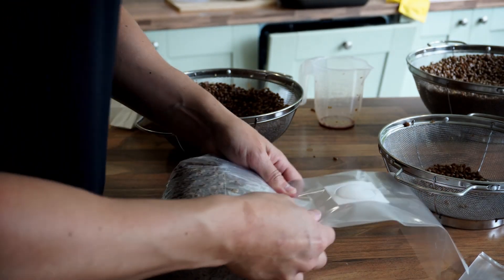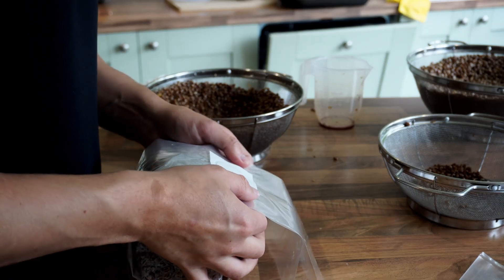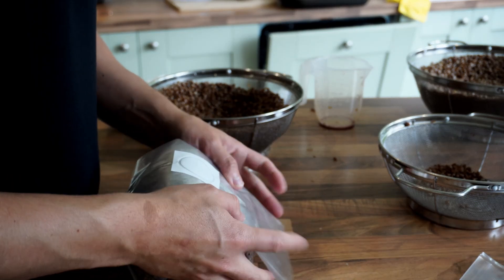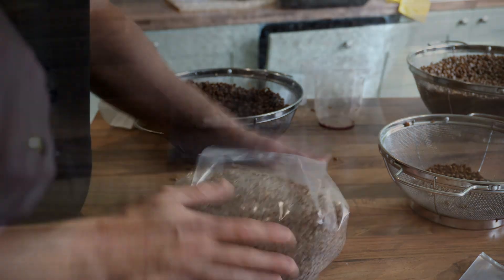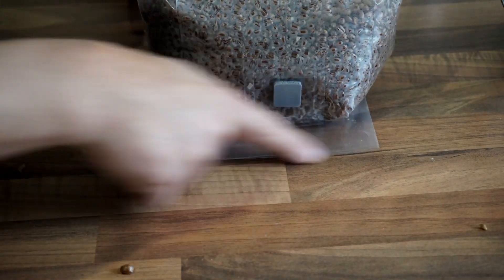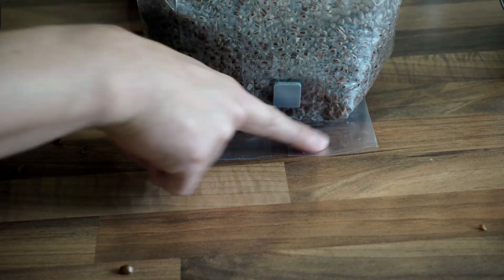If you have a look you'll see I'm not sealing the grain bags before they go in the pressure cooker. You just want to fold them under and then during the pressure cooker cycle the air will get pushed out and these lips here will seal together.